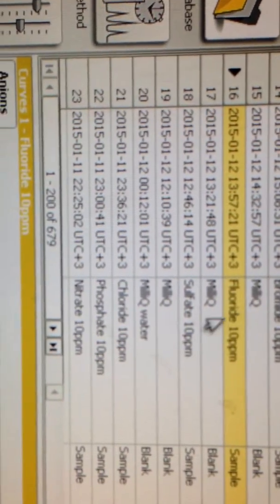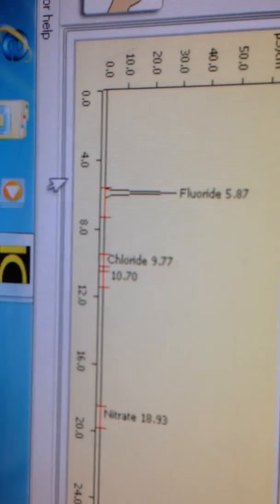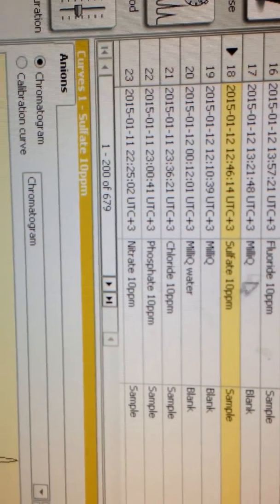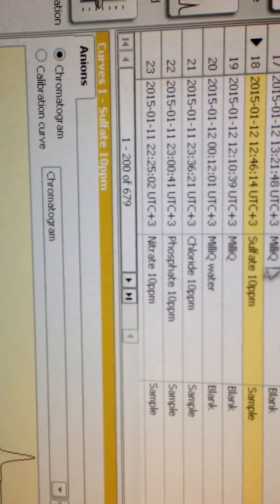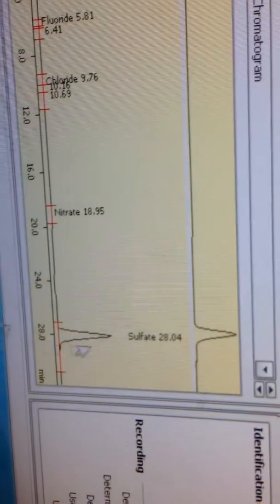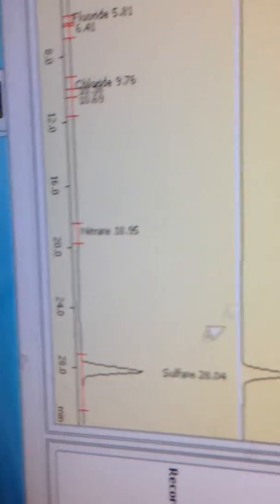Here, the next one down is fluoride. Fluoride at 5.87 minutes. Then sulfate. So I was doing individual injections of the standards just to see the retention times.